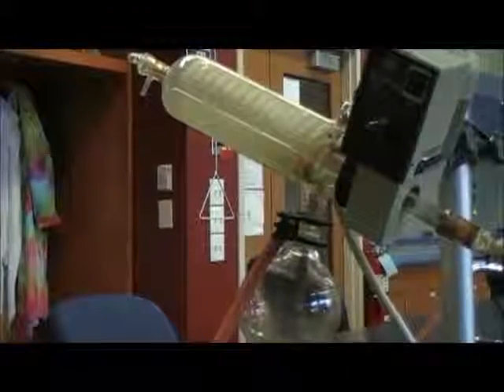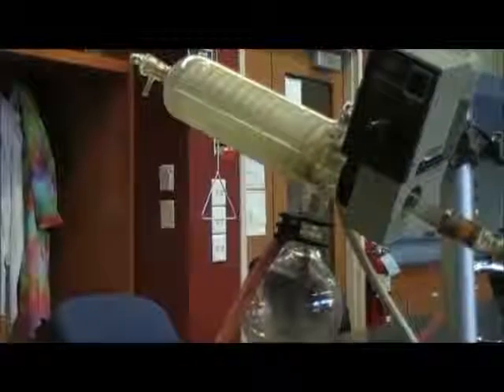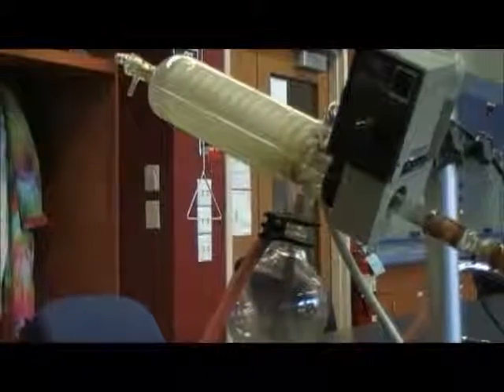Hello, in this video I will be showing you the rotary evaporator and how we use it to evaporate solvents from samples that are dissolved in a solvent.